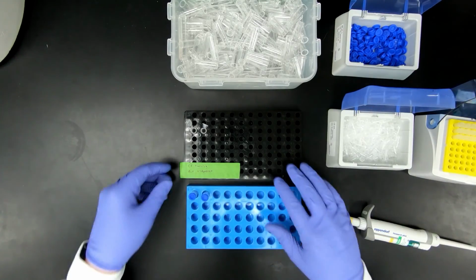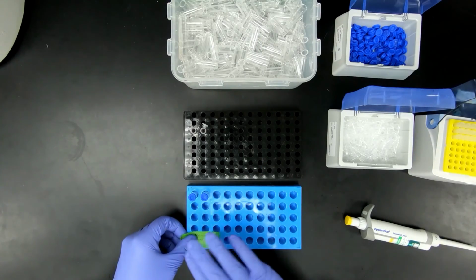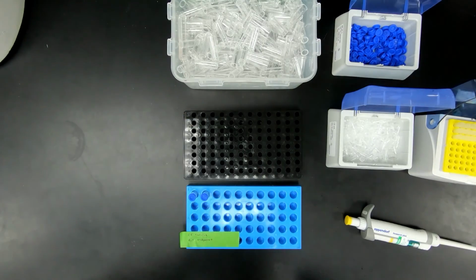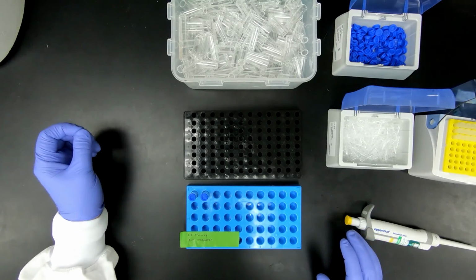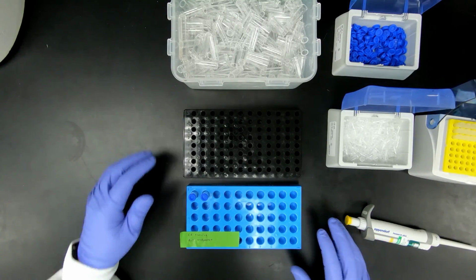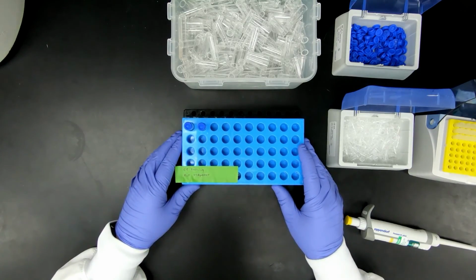After you do that, transfer your label. You can dispose of these vials. Those vials need to be disposed of in the hood because they have BME still in them. Your samples are now ready to be put onto the system.